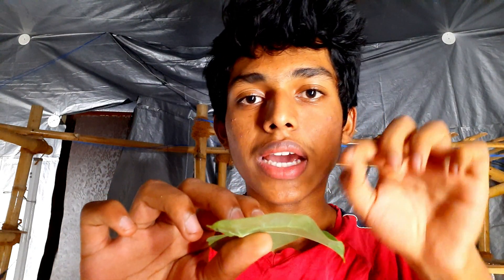How's it going guys? It's been a while since I made a video. So today I'm just going to be viewing the cells of this leaf down the microscope.